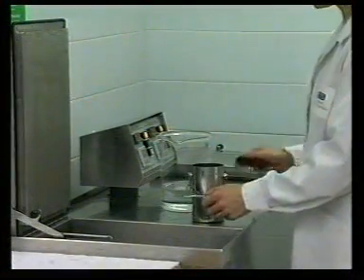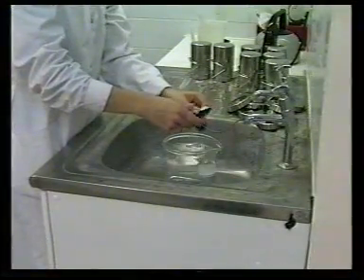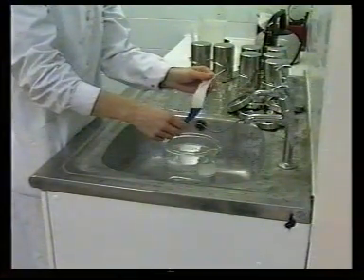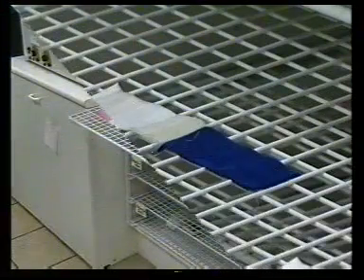When the machine stops, the test specimens are immediately removed and placed in beakers of water, then rinsed under running water for a given time. The excess water is removed by squeezing, then the specimen along with the multifibre strip is placed on a plastic covered mesh tray to dry. The specimens are laid out so that the multifibre strip is not in contact with its test specimen.